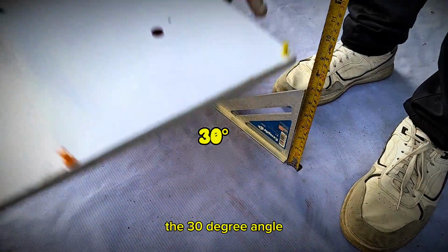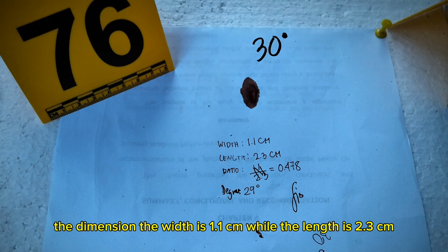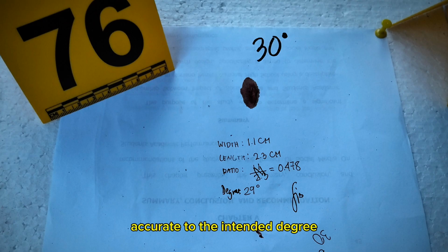The 30-degree angle. The shape is highly elongated and narrow. The dimensions: the width is 1.1 cm, while the length is 2.3 cm. The ratio is 0.478. The calculated angle: approximately 29 degrees, accurate to the intended 30 degrees.